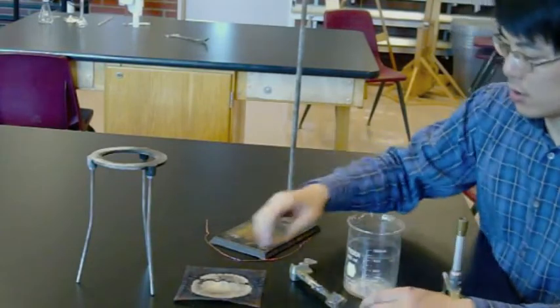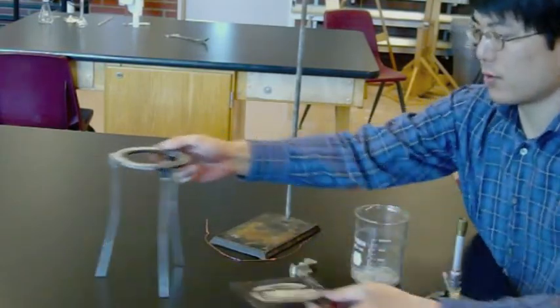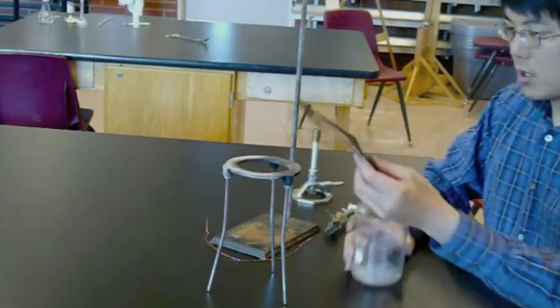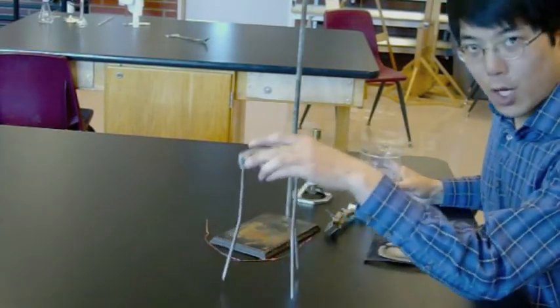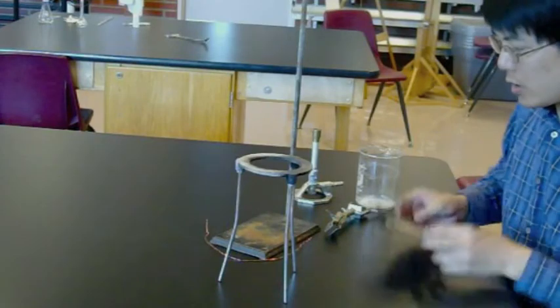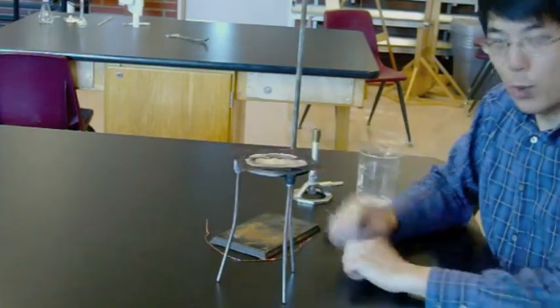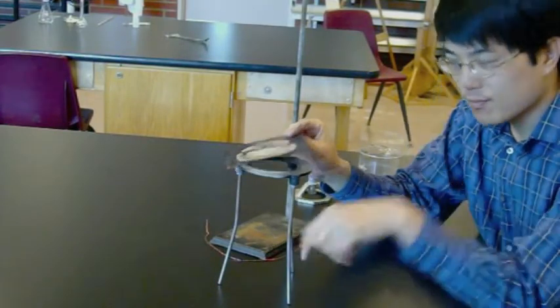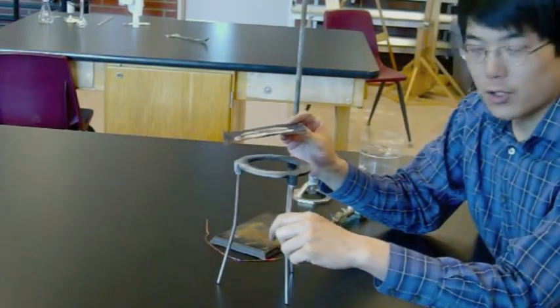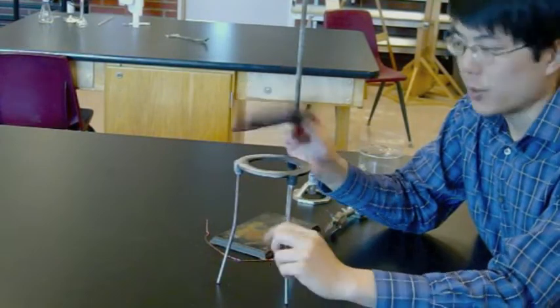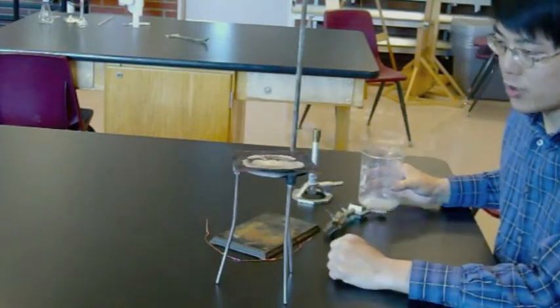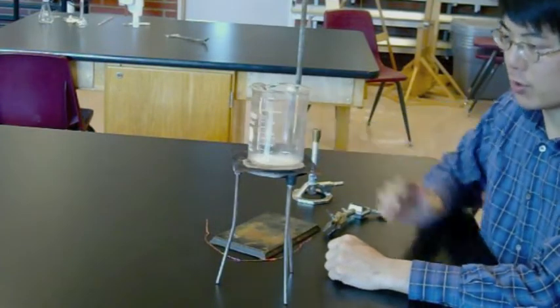So the hot water bath consists of, start with the tripod, and you put the copper wire gauze on top of it. There's going to be some soot on the tripod, don't worry, it's harmless. Copper mesh on top of that, big beaker on top of that.